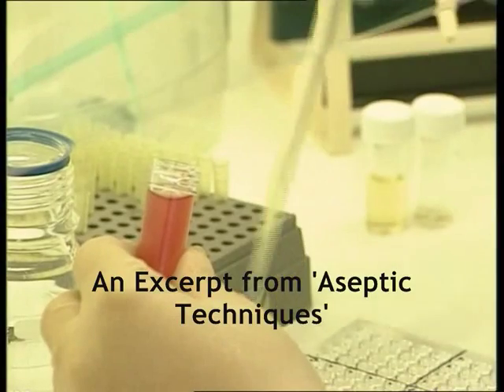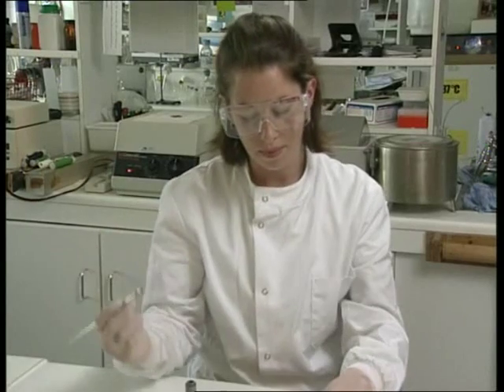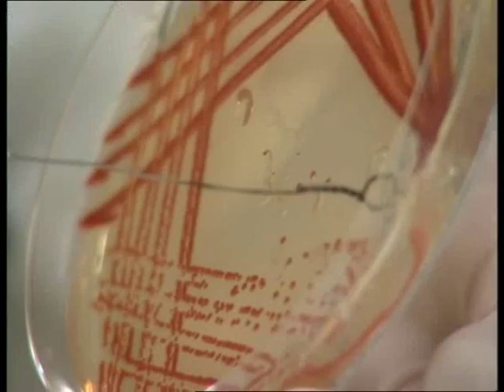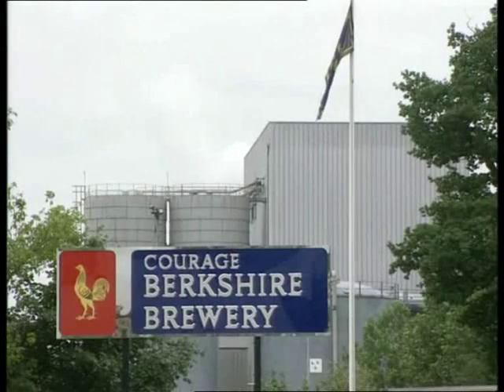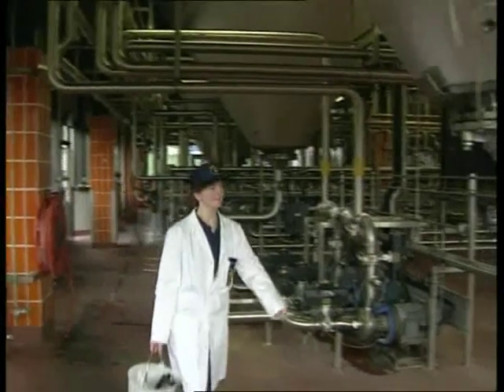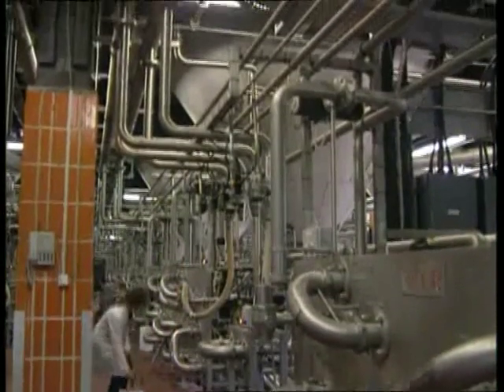Aseptic technique is about containment of microorganisms. Although the techniques and methods used vary greatly, the principles of containment are always the same. Aseptic technique is not just a laboratory practice, but is common to a great many activities, from the manufacture of pharmaceuticals to food processing.